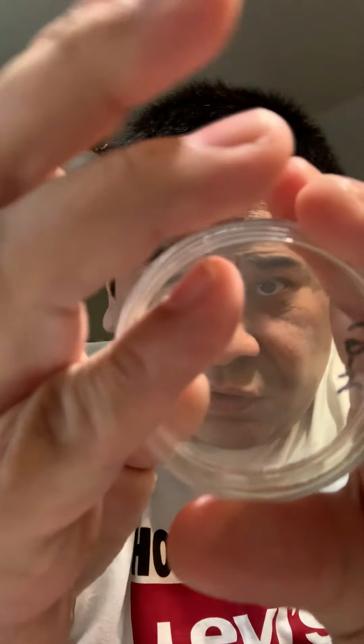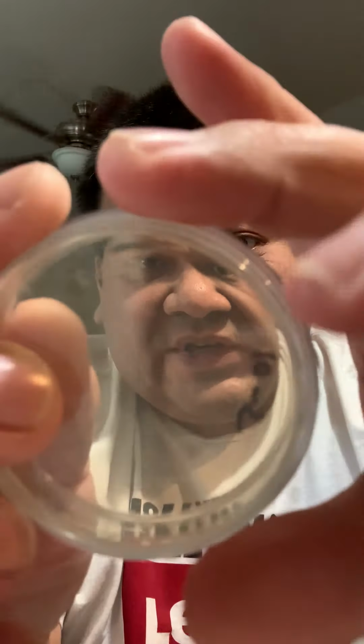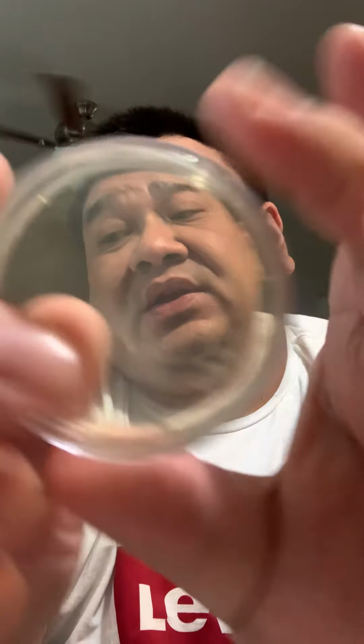For 10^-4, nothing on the corners and nothing in the middle or throughout. Same thing for 10^-5: nothing in the middle, nothing on the corners, nothing in between. And 10^-6, even worse. You could see my face very clearly. Nothing around the corners, nothing in the middle, nothing surrounding it.